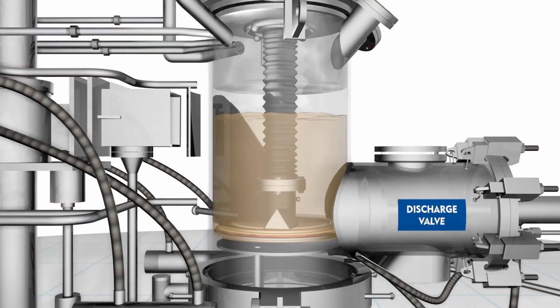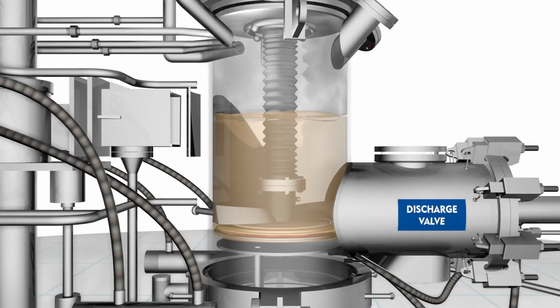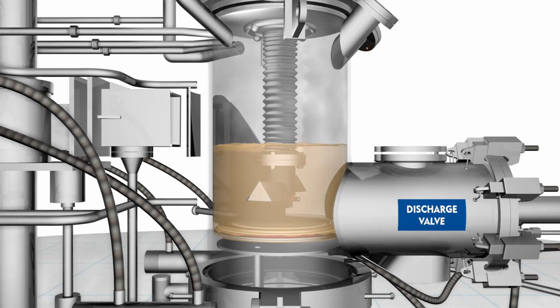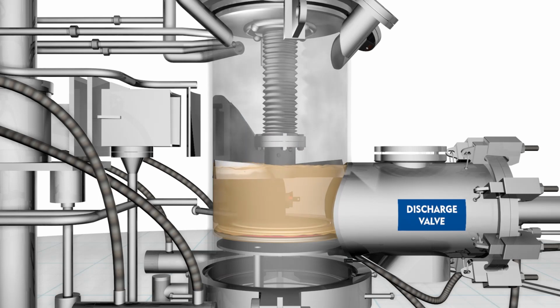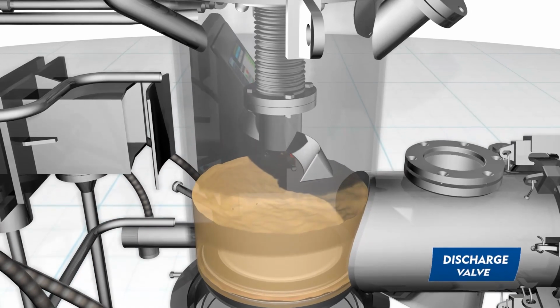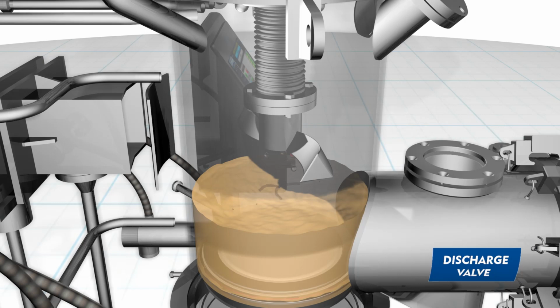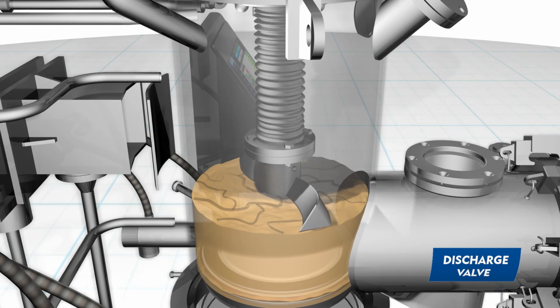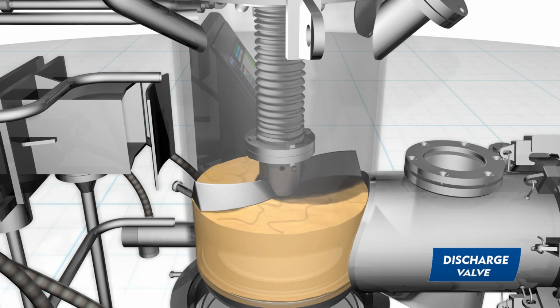The control valve for N2 or air pressure CV3 is opened to apply pressure on top of the slurry to give higher delta P for the filtration. The pressure transmitter PT1 will measure the pressure and will close the control valve CV3 if the pressure exceeds a certain set pressure. The agitator is rotated in the slurrying direction by starting the agitator motor M1. The rotation is continued for a preset time.